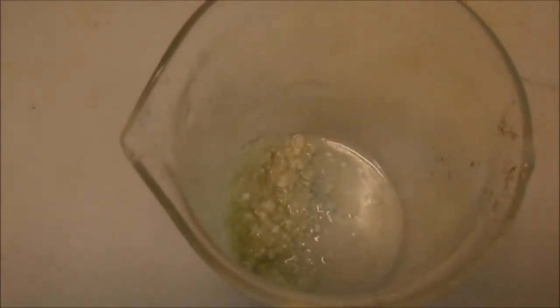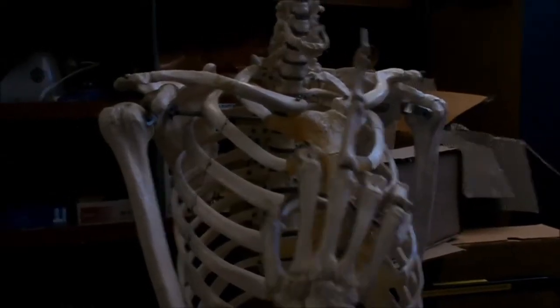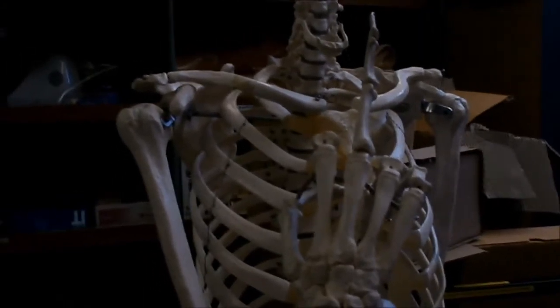So that's pretty fresh white silver nitrate that will slowly go grey with light exposure. And there's some green contamination of copper ions in there. It was definitely silver nitrate.